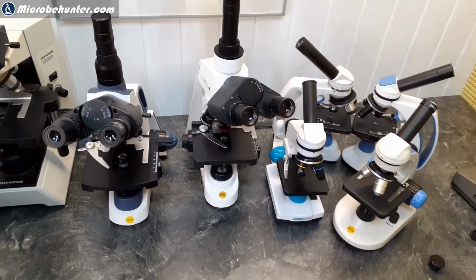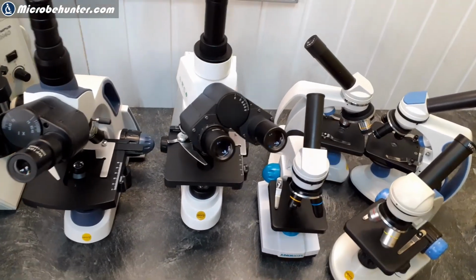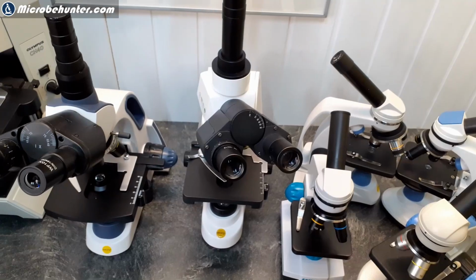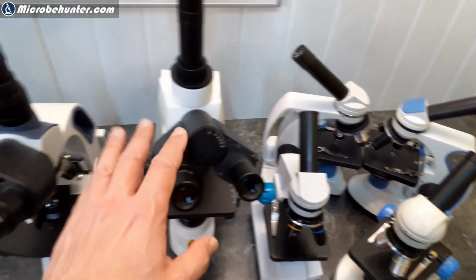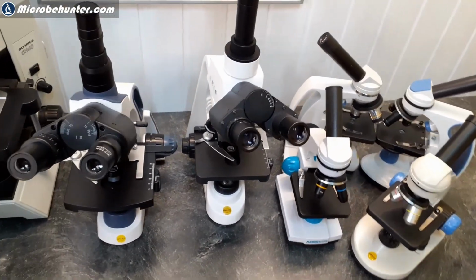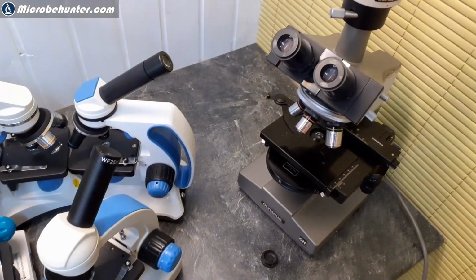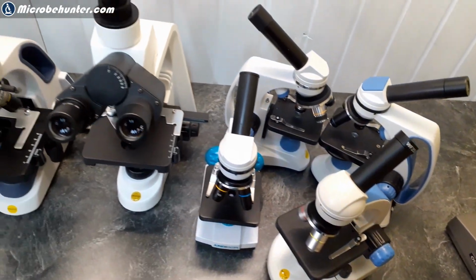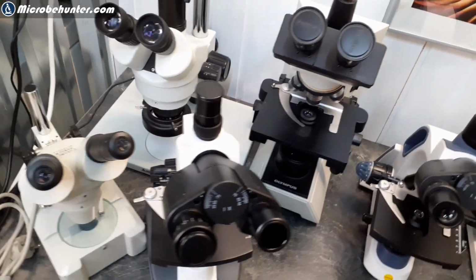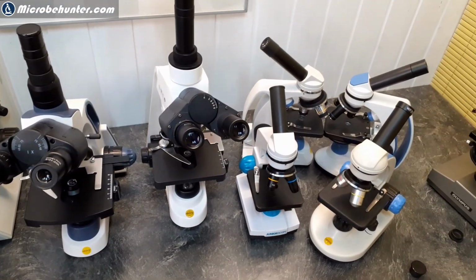But I'm not going to talk about those very high-end microscopes because they cost 10 times as much sometimes. Well, not 10 times as much, but the cheapest one that I was able to find was over €1,000. But the features were not different than the ones that you have over here. But you get so much more support and quality and resale value, and this is what you pay for. And they have dedicated service companies that deal with them. So research and medicine, universities, will probably still use microscopes of the high-end brands.